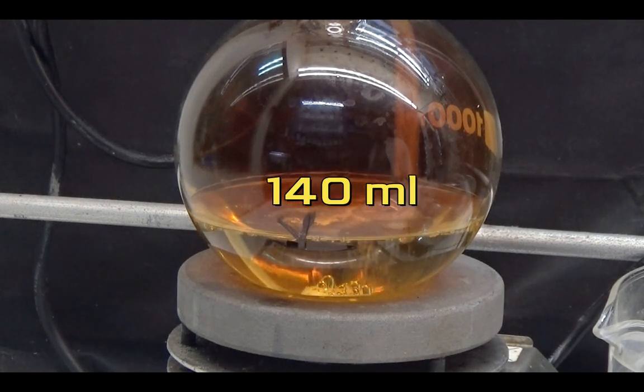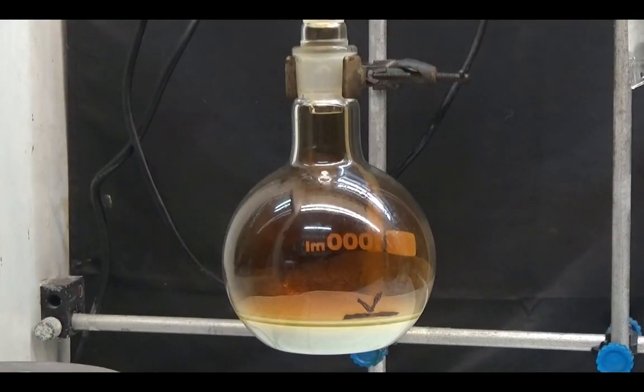When the flask reaches 140ml, allow it to cool. There appears a white precipitate.